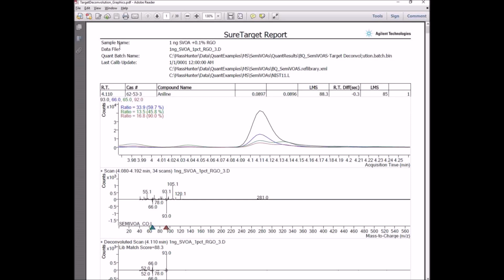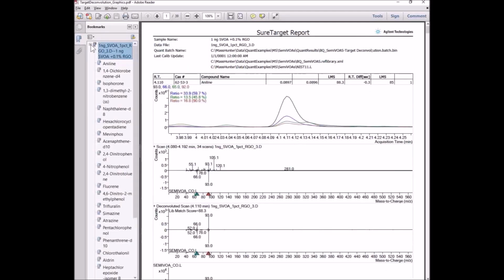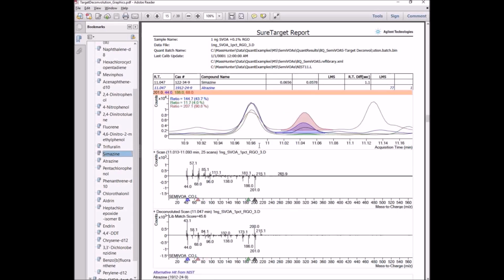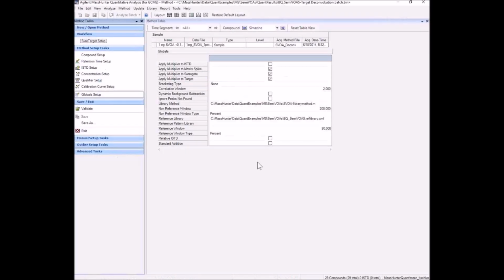Let's take a look now at the detailed graphics report, which has the bookmarks. So let's look down into this particular sample, and we can see the compounds that are documented here. Let's take a look at simazine. And here we have the graphical presentation of that same information. There's atrazine with a better library match score. And if we go down here, you can see that this is the spectrum that was retrieved from NIST, which got that better library match score, also documenting the qualifier ratio and the clean spectra that was used to search the NIST library.